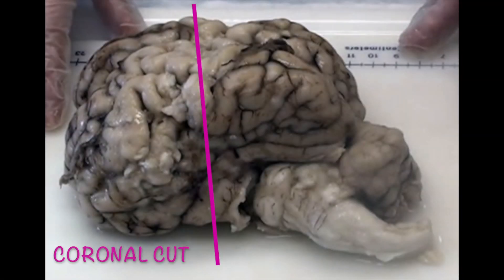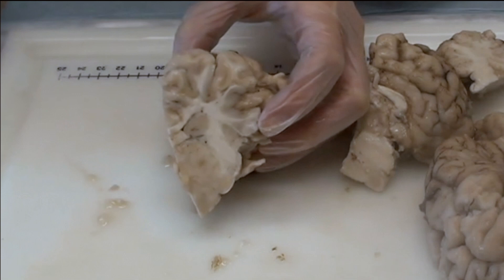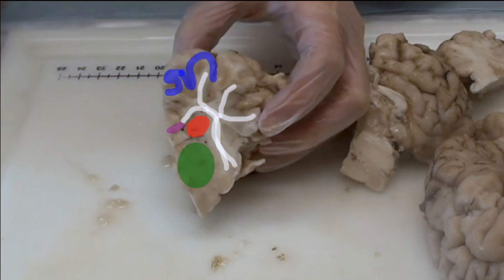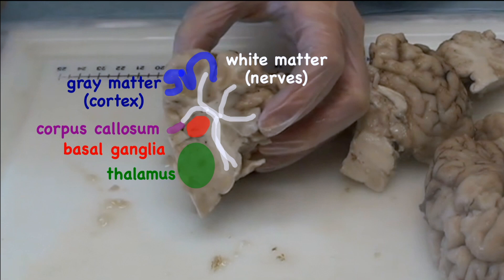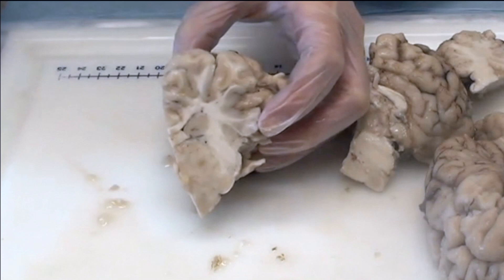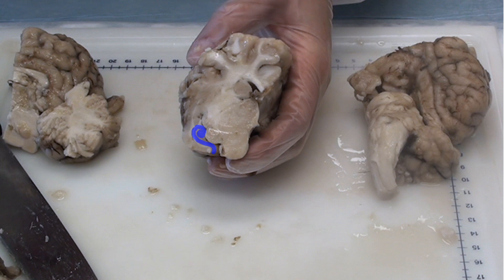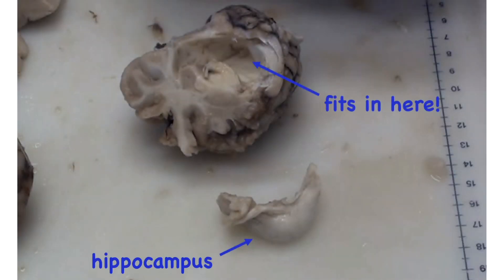Next we cut the brain in half coronally. Here we can see the corpus callosum again in the middle. We can also see the white matter, where brain cells from inside the brain are sending signals up to the grey matter on the outside of the brain. That outside layer of grey matter is called the cortex. We can also see the basal ganglia, which is important in movement and emotion, and the thalamus, which collects information from your five senses and sends it to the rest of the brain. A little further back in the brain, in the bottom of the temporal lobe, we can see the hippocampus. This little structure is important for memory. Here it is in its usual place in the brain, and here we've dissected it out so you can see it a little better.